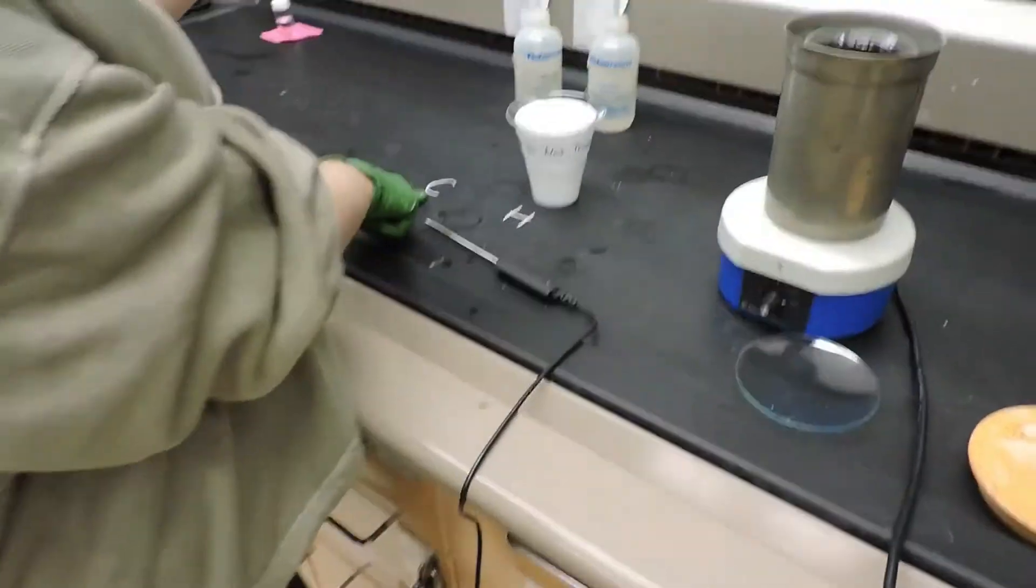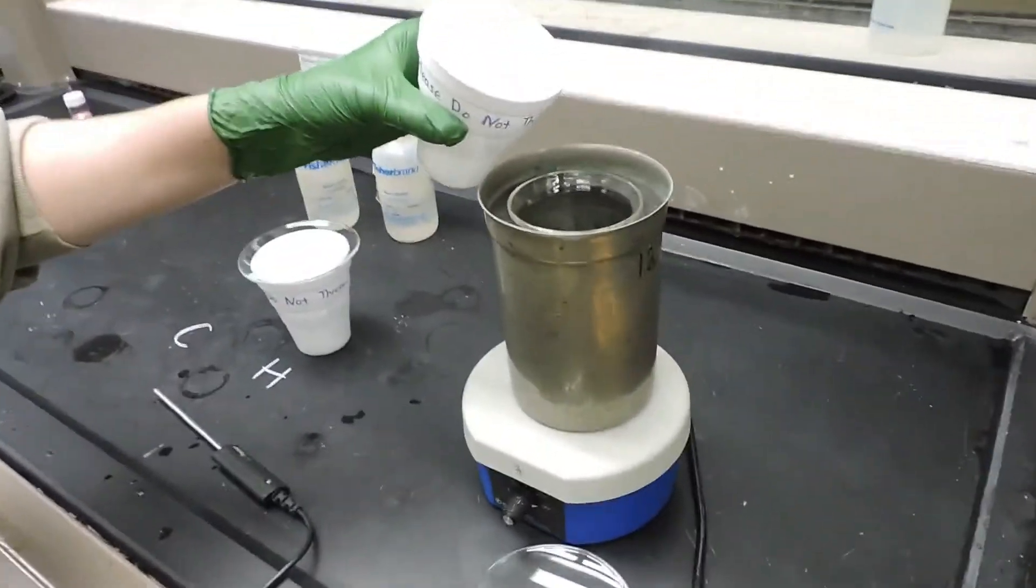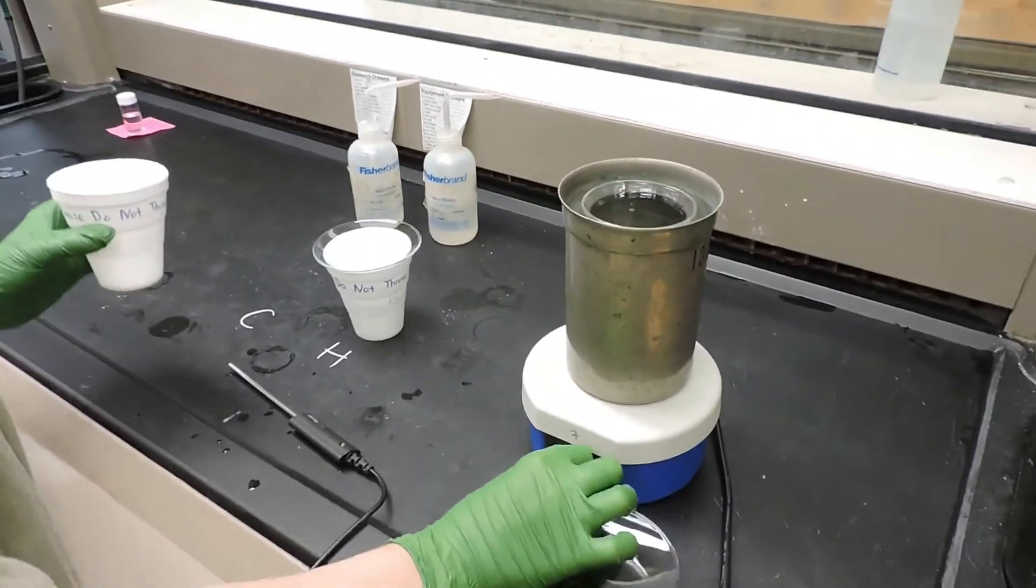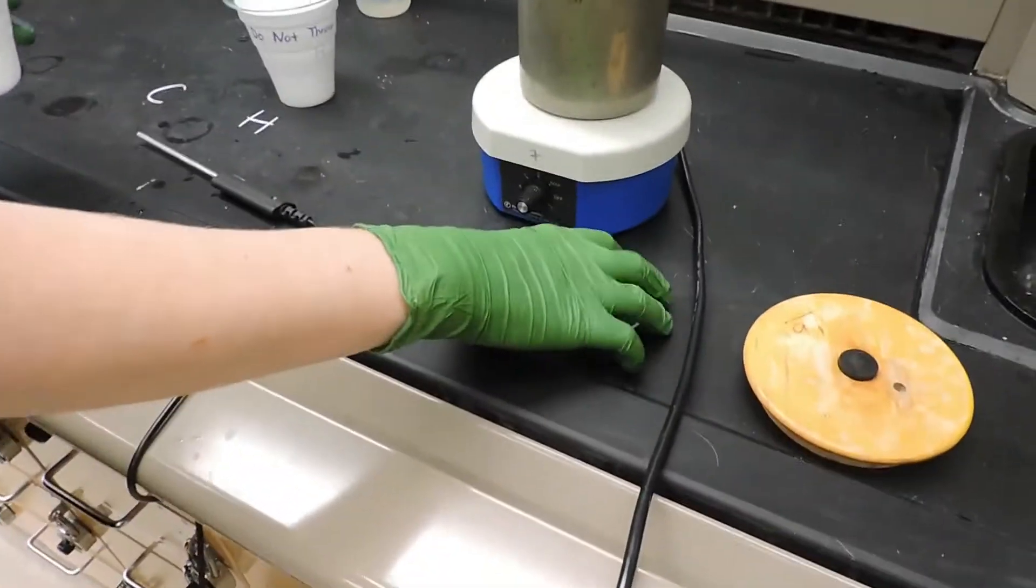What we're going to do now is introduce the cold water into the calorimeter and begin stirring.